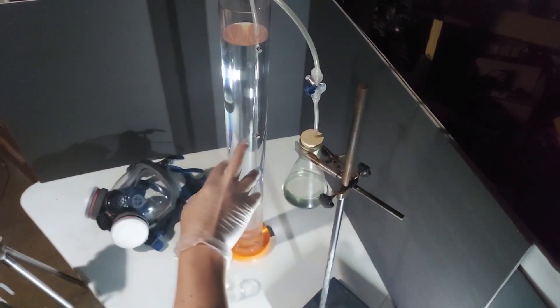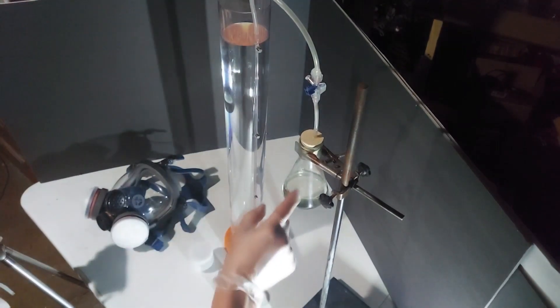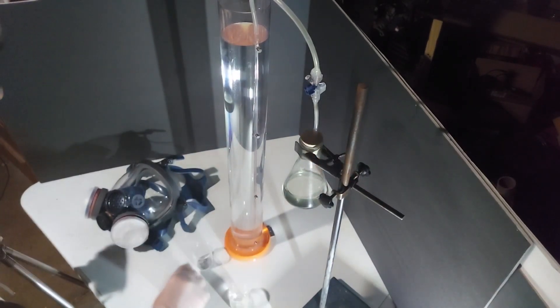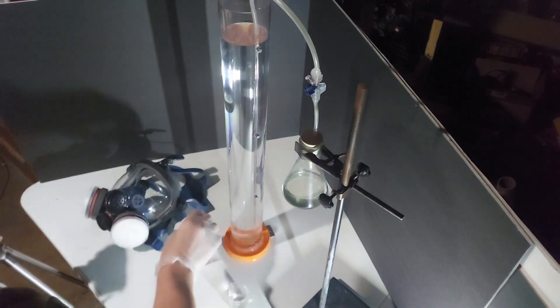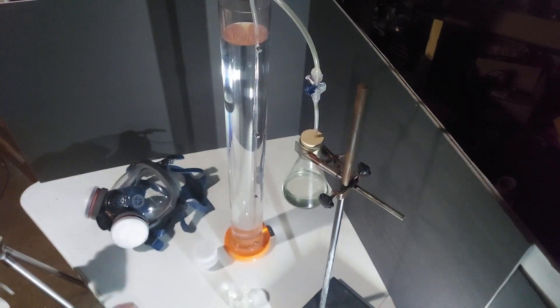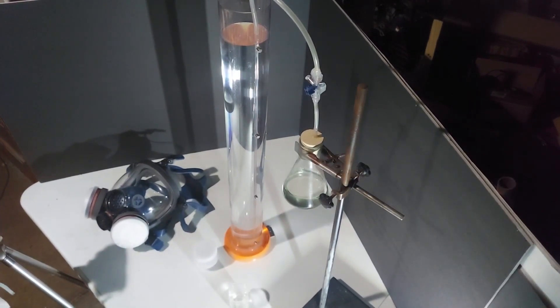Setup is complete. The bleach is in here, water is in here, this is my six molar hydrochloric acid — 10 milliliters — there's 100 milliliters of regular over-the-counter bleach, distilled water, and in here I have my calcium carbide, five grams, capped just to keep any moisture out. I will be using a gas mask while doing this because chlorine gas is involved, so I won't be saying anything.